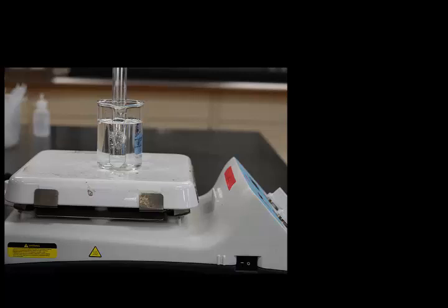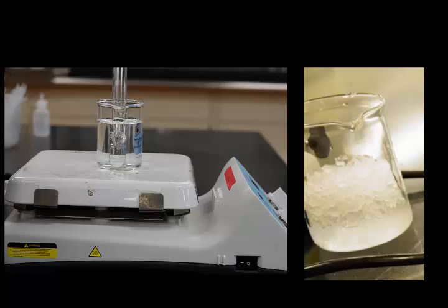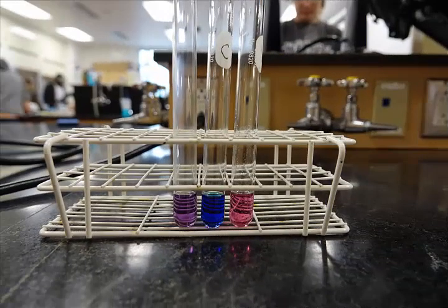Make this by placing a small amount of water in a beaker and placing it on a hot plate. The third test tube should be placed in an ice bath. Make this by placing some ice and a small amount of water in a beaker. You should see some change in color when you heat or cool your sample. When you're finished, all of your waste can go in the waste container.